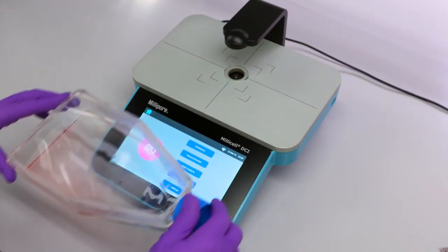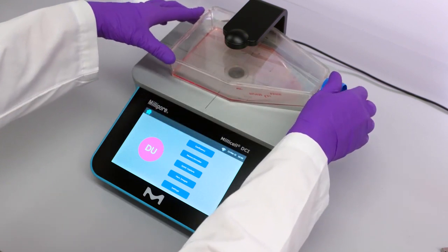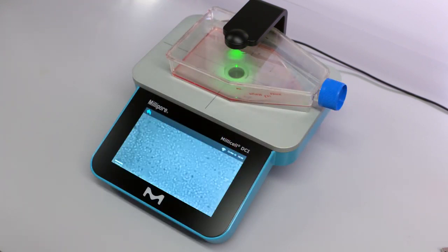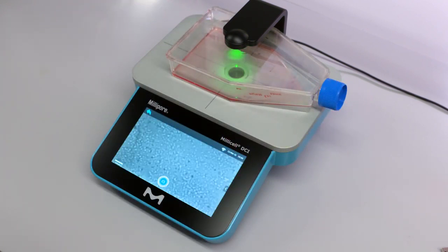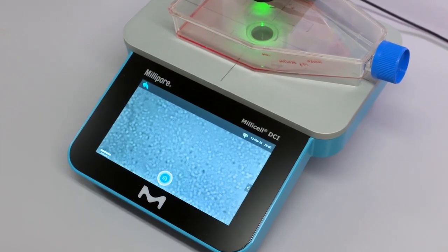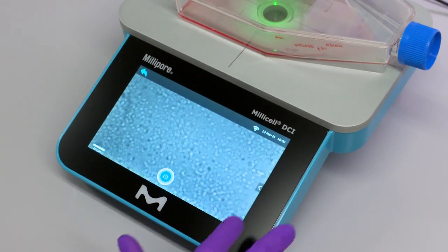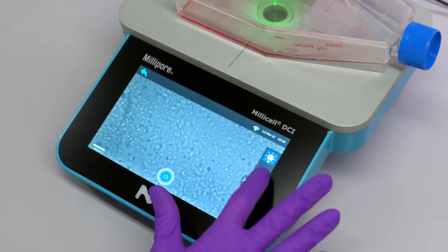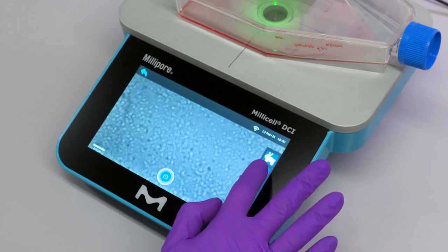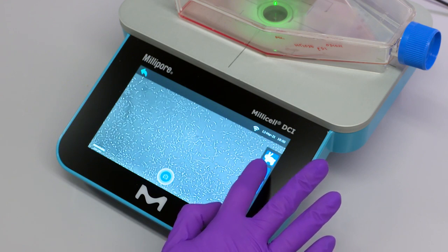Place the flask on the stage. The image will automatically be displayed. The settings can be adjusted by clicking on the arrow on the right. Once the lighting and focus have been adjusted accordingly, click the capture button.